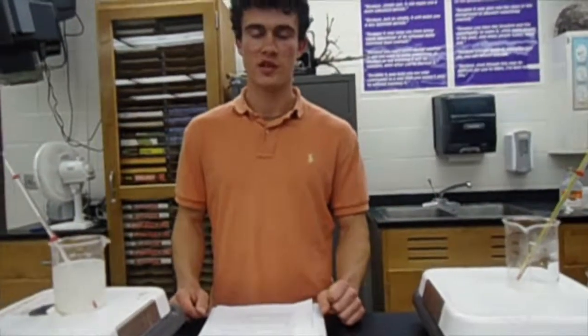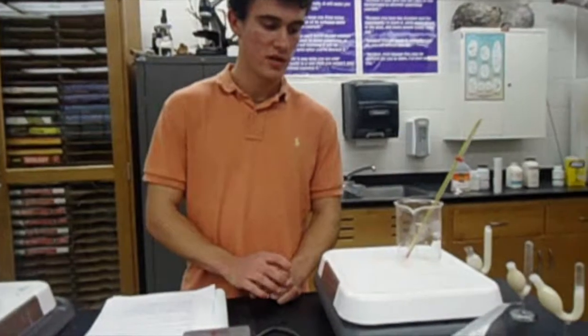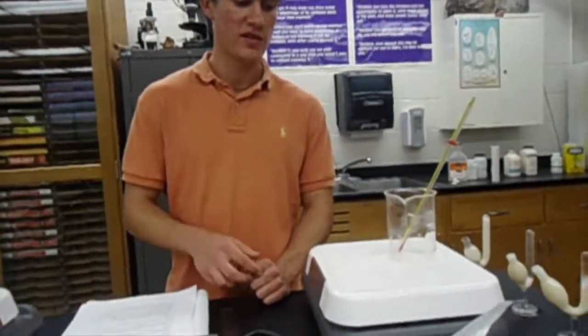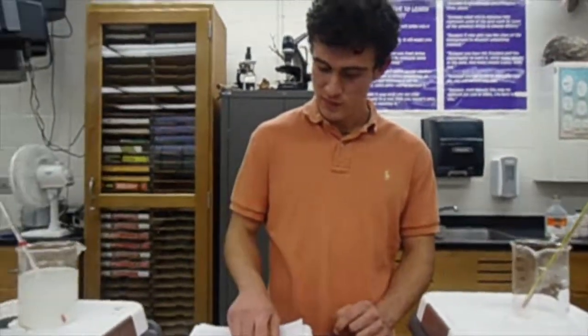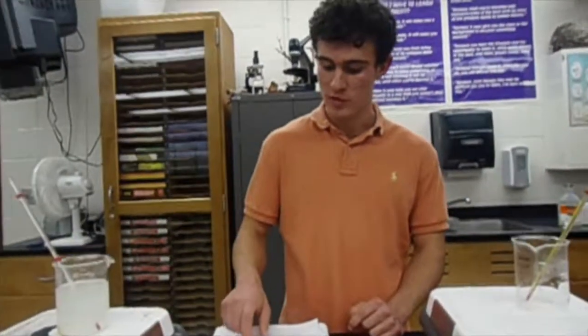We're predicting that they denatured or the cellular respiration process was completely used up, so it just stopped. This one, also a warm temperature, kept on increasing fast at first and then more gradually. Basically our hypothesis was correct, that in the fermentation tube we'll have a greater buildup of carbon dioxide if it's in a warmer temperature.